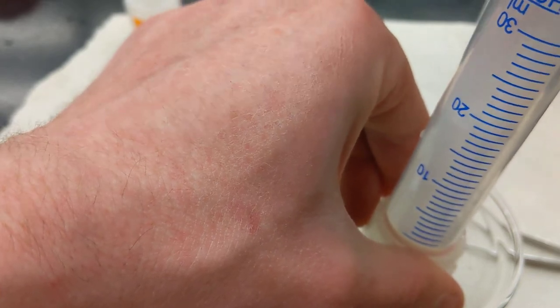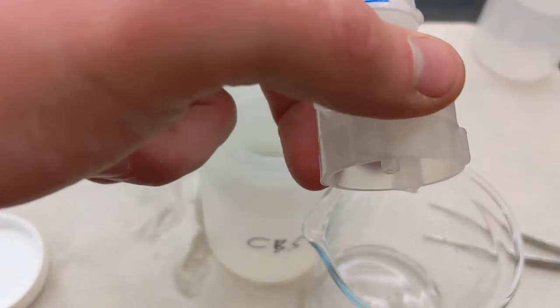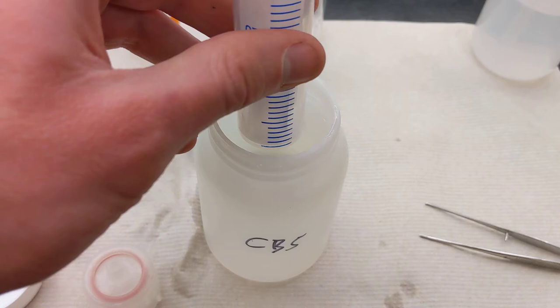And I will pre-rinse my filter rig with just a couple mils. That makes sure I get a nice sample coating on my filter and on my apparatus so there's no cross-contamination or dilution.